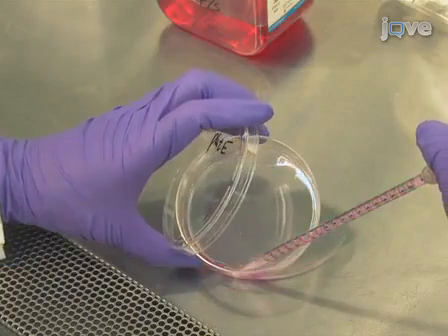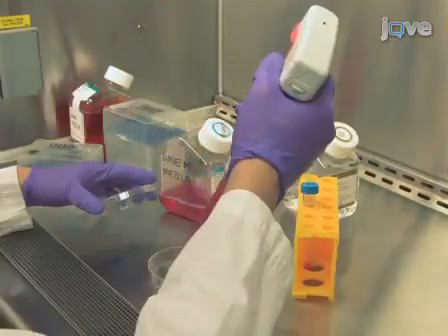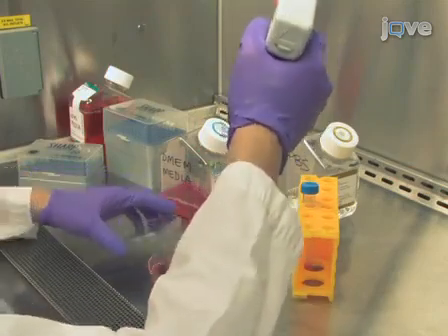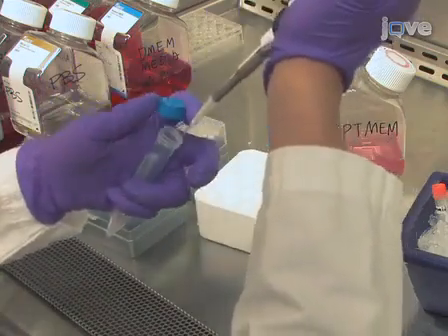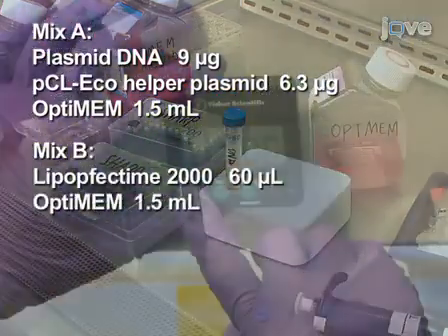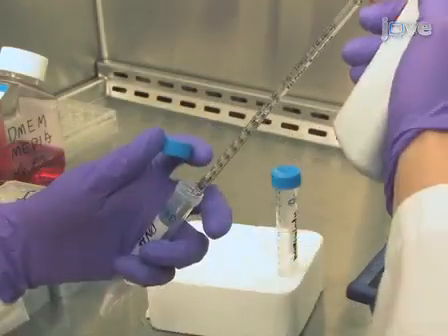Gently remove the media from the plate, wash the cells once with 1x PBS, and add 10 milliliters of pre-warmed fresh DMEM media without penicillin or streptomycin. For the lipofectamine transfection complex, prepare 2 mixes in OptiMEM, one of DNA and the other of lipofectamine reagent. Equilibrate separately for 5 minutes at room temperature, then mix together gently and incubate for 20 minutes at room temperature.